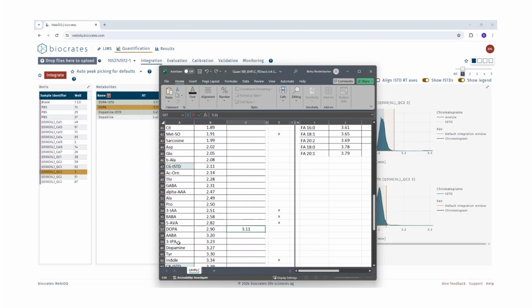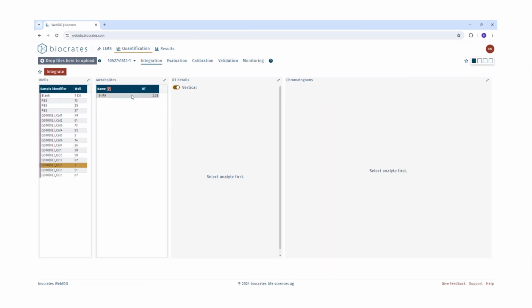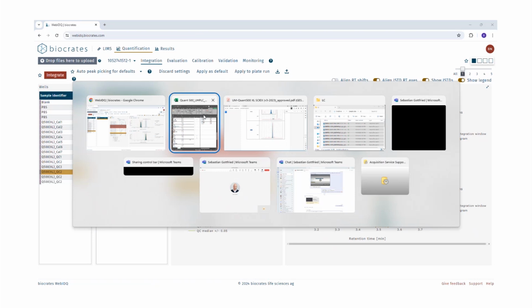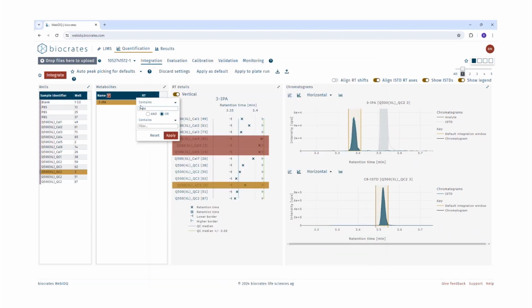And then we check the peak eluting after AABA. Again, we define here the name of the metabolite in the search field. Select the metabolite and we can see that it's well integrated and it is eluting around 3.38 minutes. So we go back to the Excel sheet, we note down the retention time of this metabolite, and now by checking the metabolites eluting before and after AABA, we can estimate that AABA must be eluting around 3.34 or 3.35 minutes. Now we go again back to WebIDQ to check AABA peak.